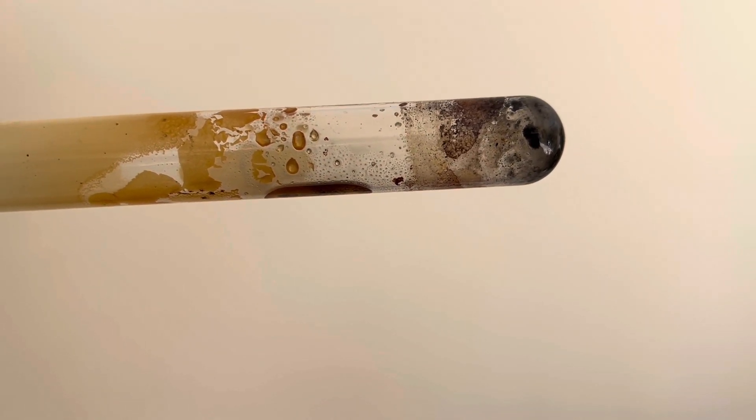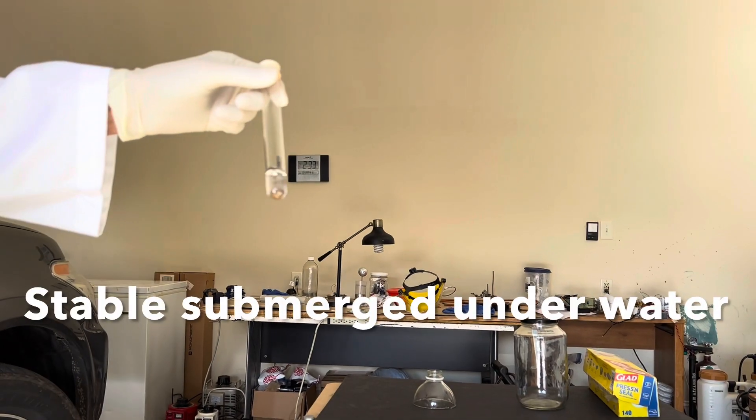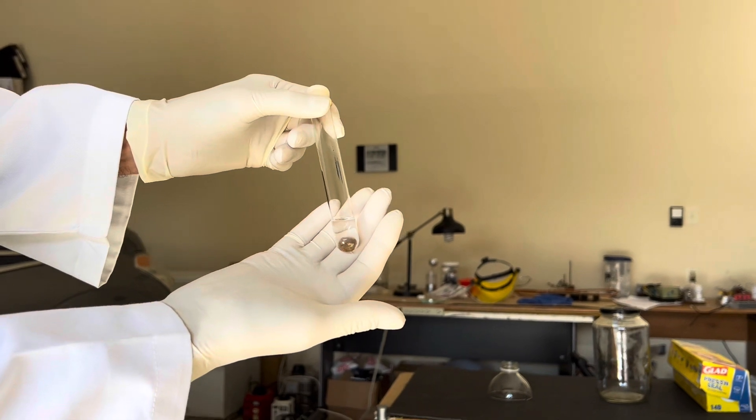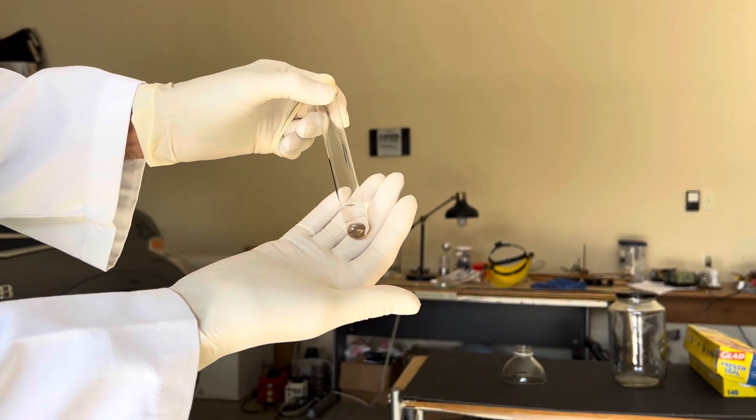When this cools down, it will solidify. It will spontaneously ignite in air. And what I want to show you today is what it does in pure oxygen.